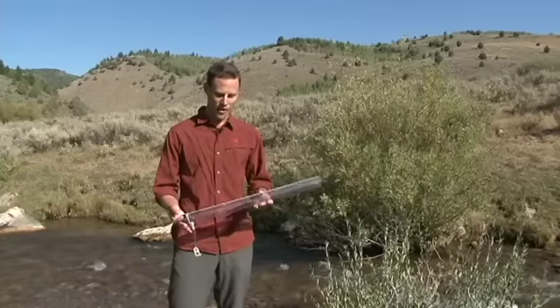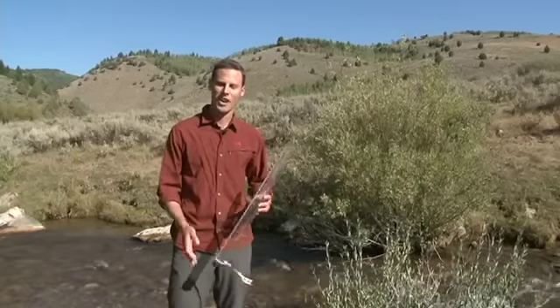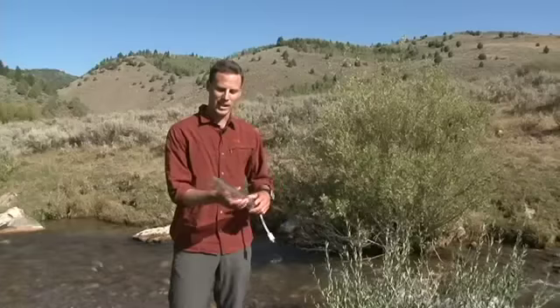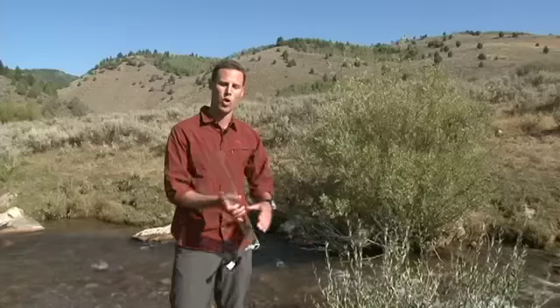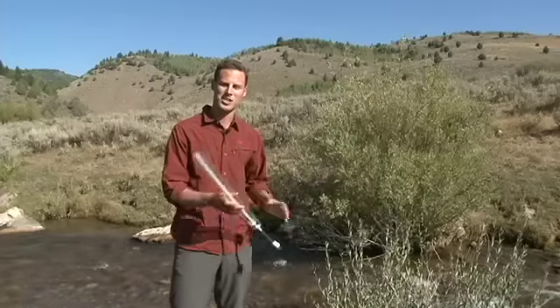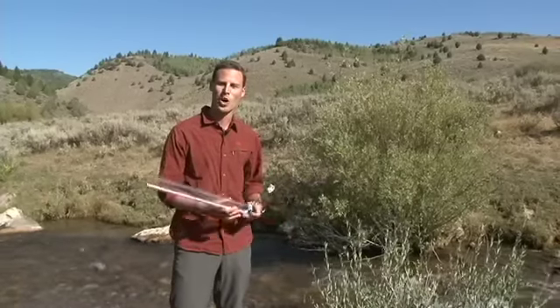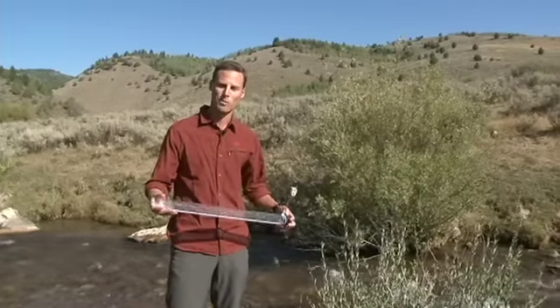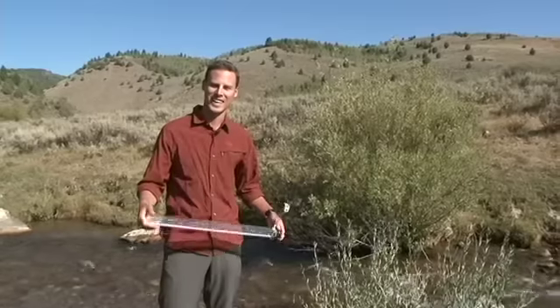This is a variation of how we do this in lakes. In lakes, we use the same Secchi disc — it's just an eight-inch disc that we lower down into the water column. If you're interested in seeing that, watch our video on monitoring turbidity in lakes.